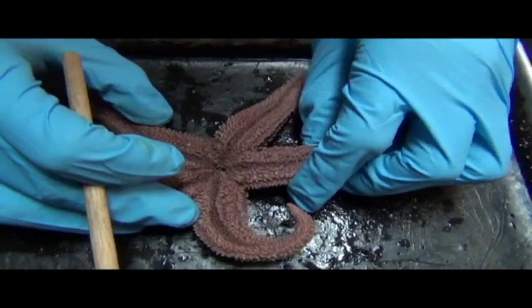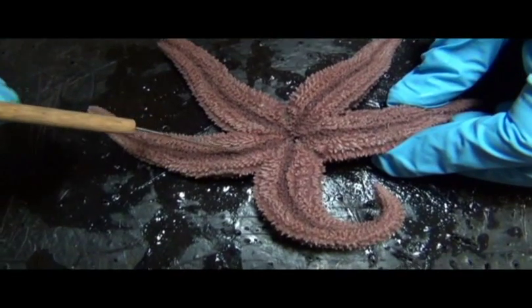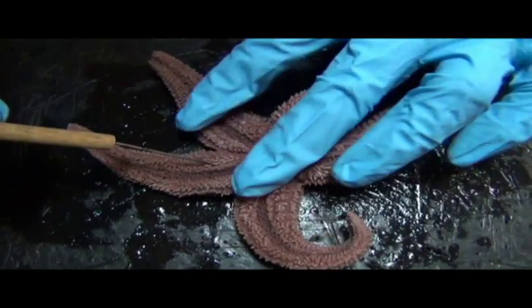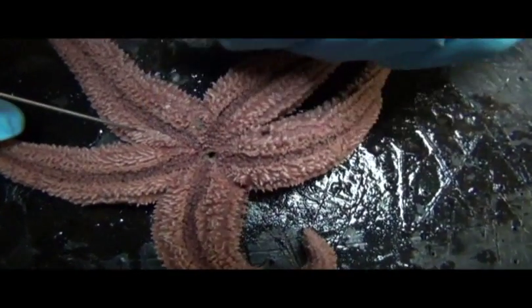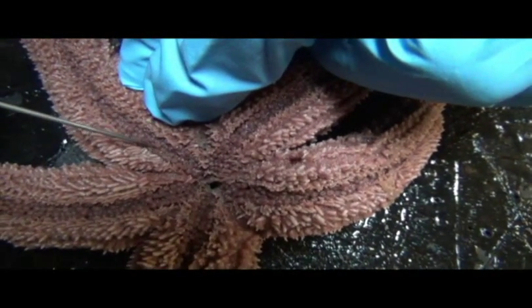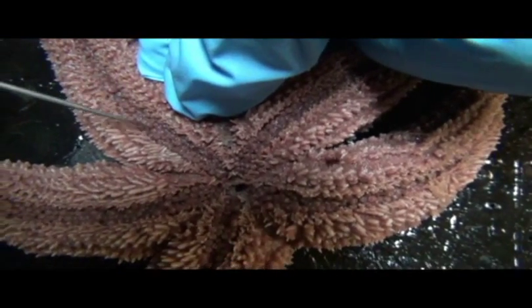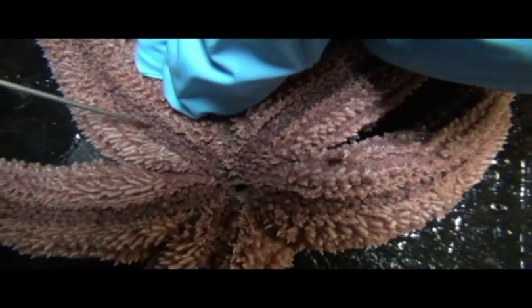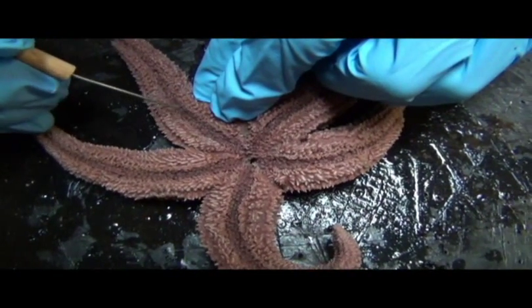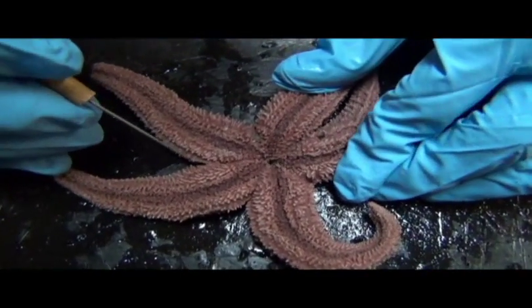Now, if you're at all familiar with this animal, you know that that's one of the major qualities on the oral surface. So in the center of the arms, you'll see these thicker lines, and within them, I don't know if you can see with the camera, there are many little tubular-like circular structures, and these are its sucker tube feet. Okay. So all of these sucker tube feet are actually controlled by the water that comes in through the madreporite, and it'll be more clear when I show you the internals of the animal.